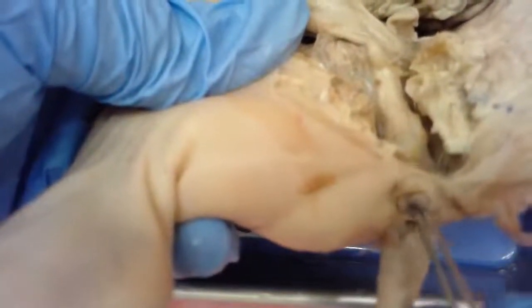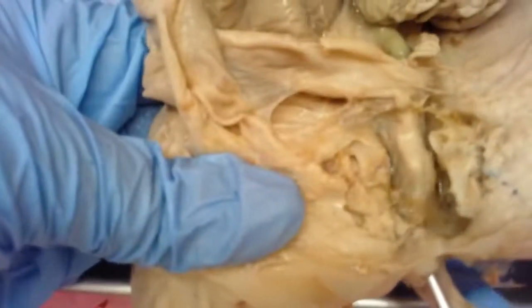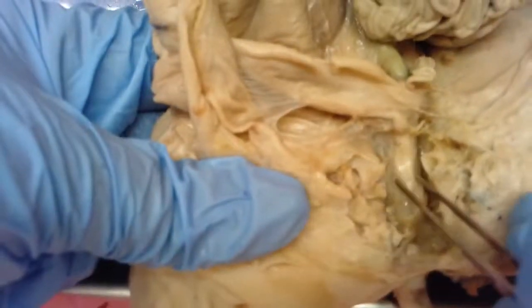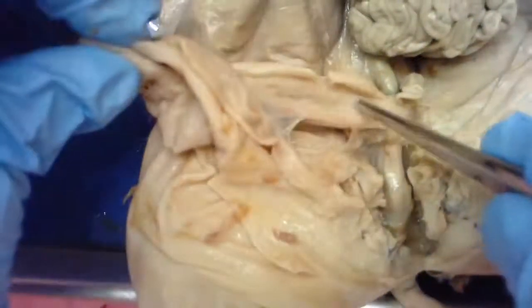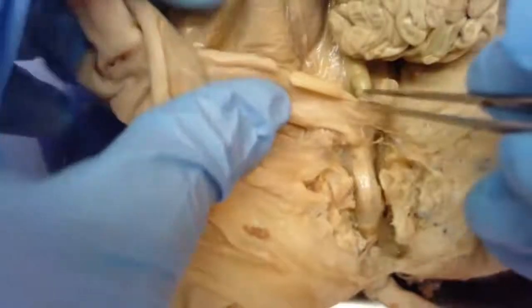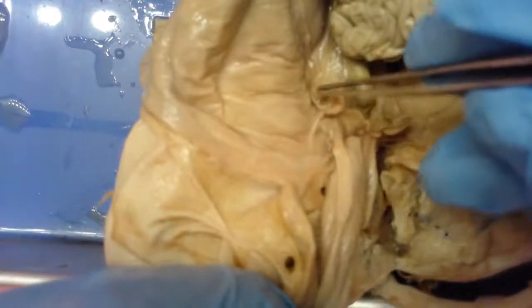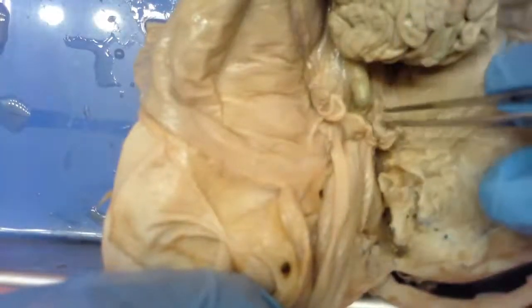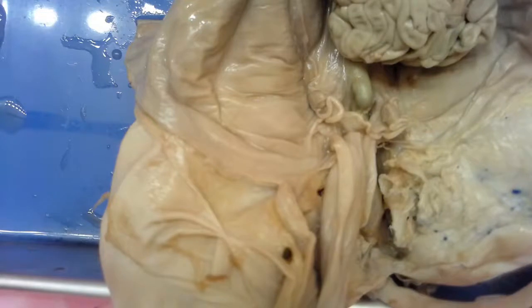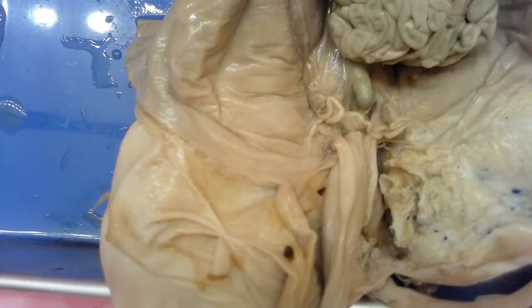The urogenital opening is just behind where the urogenital papilla is. If I insert the probe here, you can see it going into that little tube - that's the birth canal. Laying on top of the birth canal is the urethra, where urine exits from the urinary bladder. Here's our uterus, with uterine horns that connect with the fallopian tubes, which end up connecting with the ovaries where eggs are released. That's the female reproductive system - we've now reviewed both the male and female systems, so go ahead and take the review quiz.